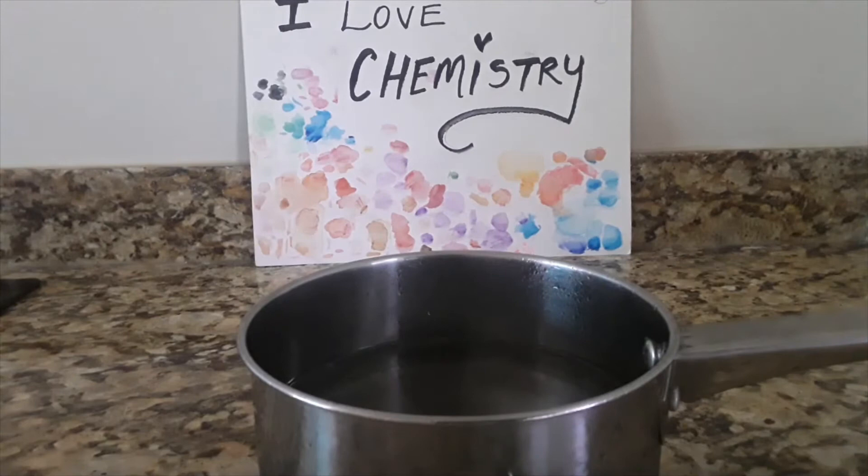After the additions, we're just going to let it react out until no more baking soda bubbles are present.